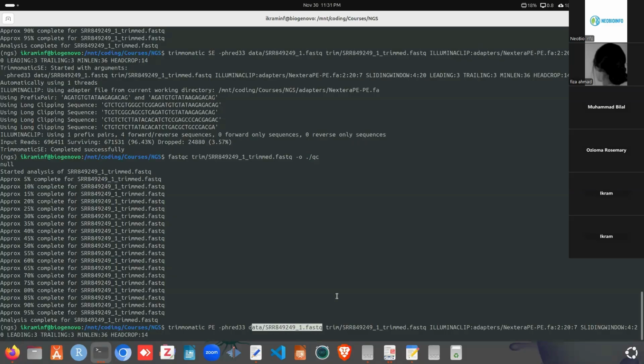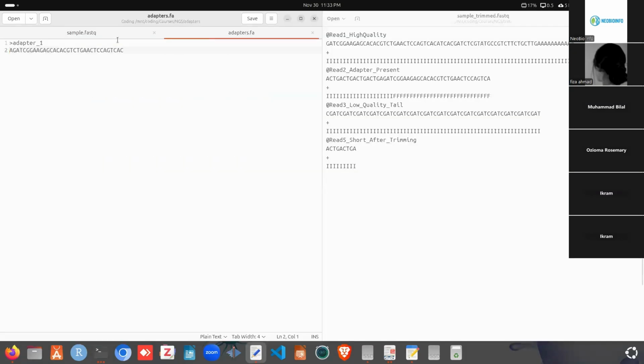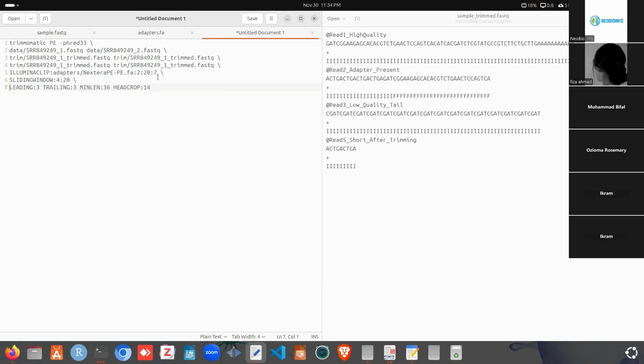We need to specify read 1 and read 2, then the output for read 1. For convenience, I can just write the command in here, and I'm explaining the command only. First, the paired-end read and the PHRED33. After that, we have two sequences, read 1 and read 2. These are the input sequences, and for the output FastQ files, we will have two files for read 1 and two files for read 2.